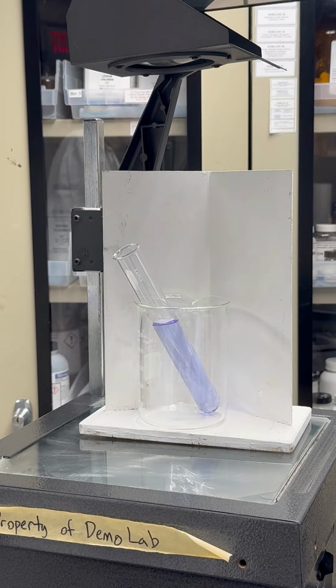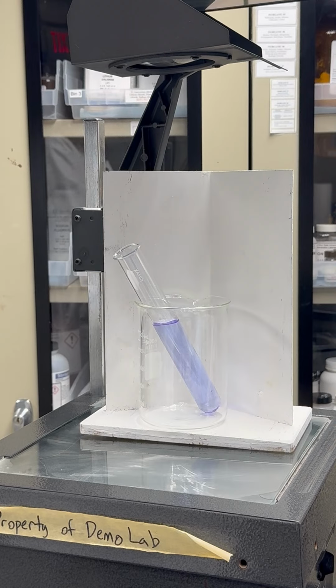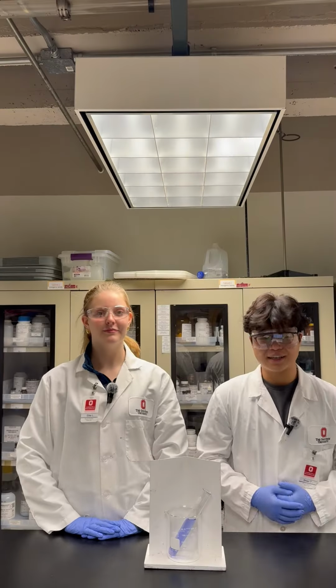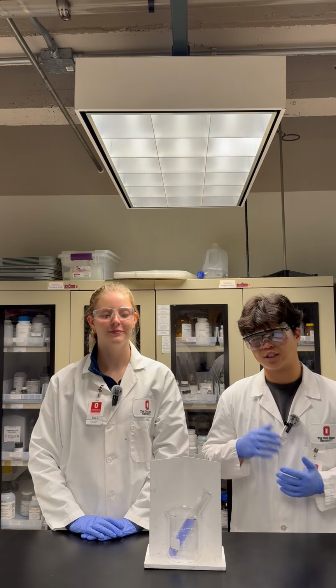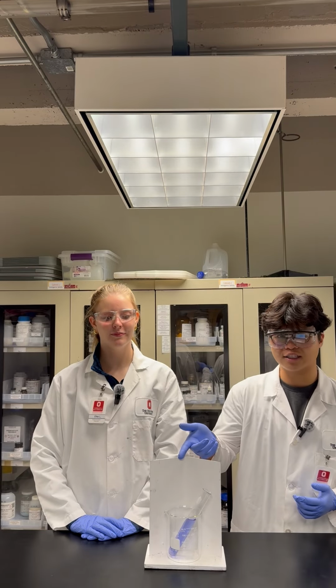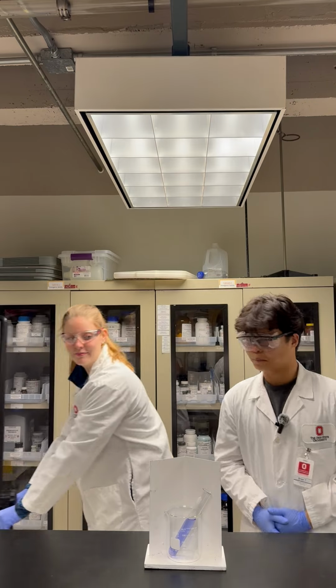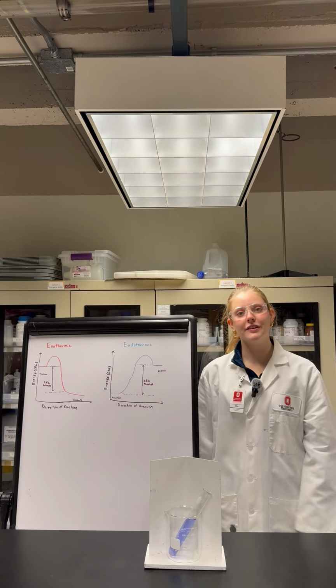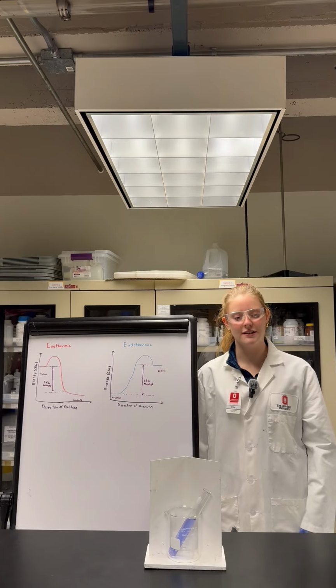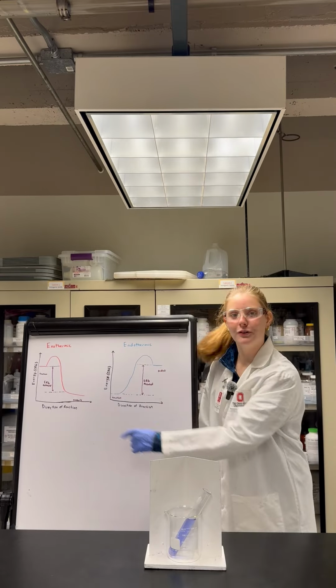As you can see, the solution is turning back to purple. But how does this happen? This reaction is definitely reversible. It looks like taking energy away, which is light in our case, reverses the reaction. If we flip the graph from earlier, we see that the reverse oxidation reaction is exothermic and favorable.